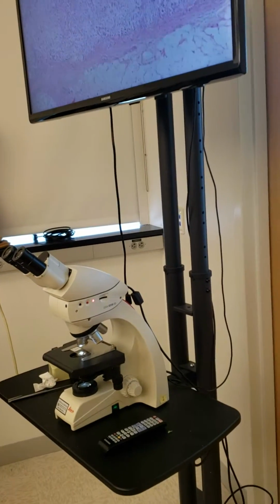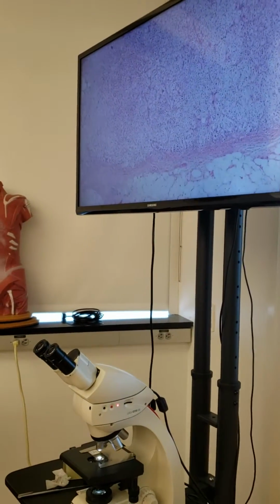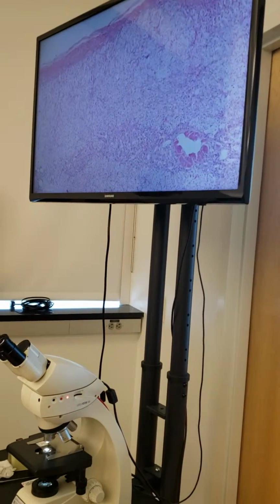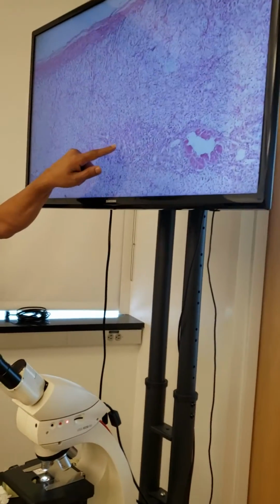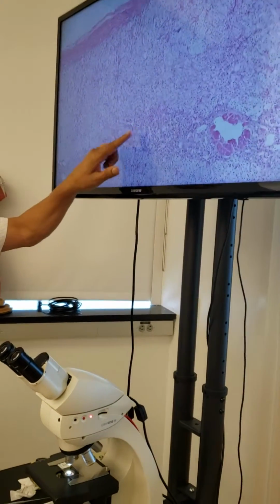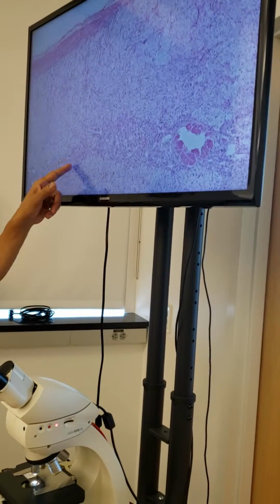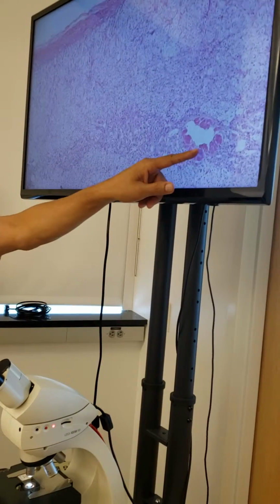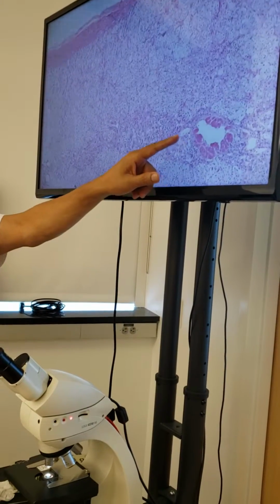Okay? Let us identify these. Because you know that they go in that order, it's much easier now. Let us look at this. For example, here. This is medulla, right? Clear, all of you? In medulla, you will also find some open spaces, maybe some blood vessel. It looks a little bit disorganized, a little bit broken up. And it is in the middle, medulla in the middle.